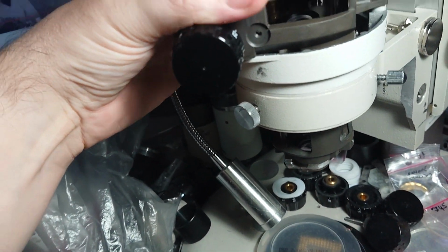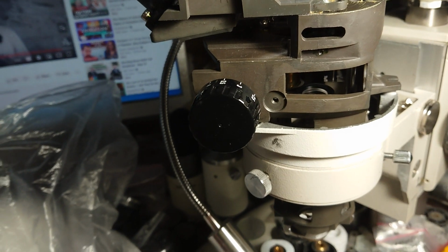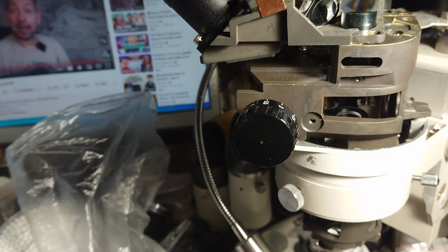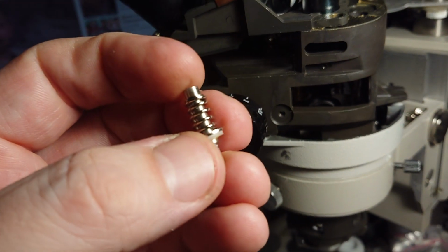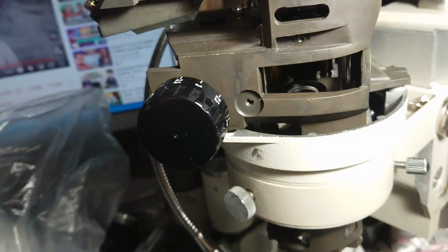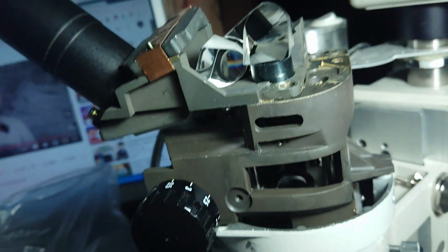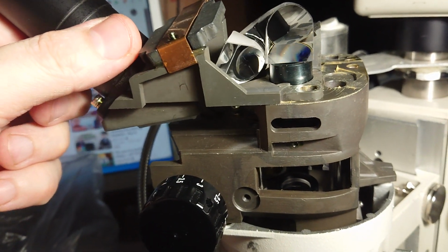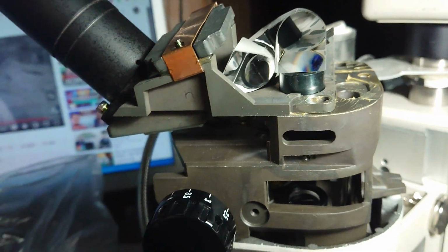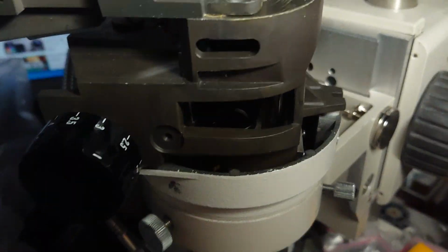And by the way, I need to say that the inclination eyepiece tube and erecting system are connected with a bolt and little springs here, so this whole system works this way. This bolt is screwed into the case, and those little springs are pushing, assembling the two parts of the microscope and the inclination erecting system. So not a bad thing in design.